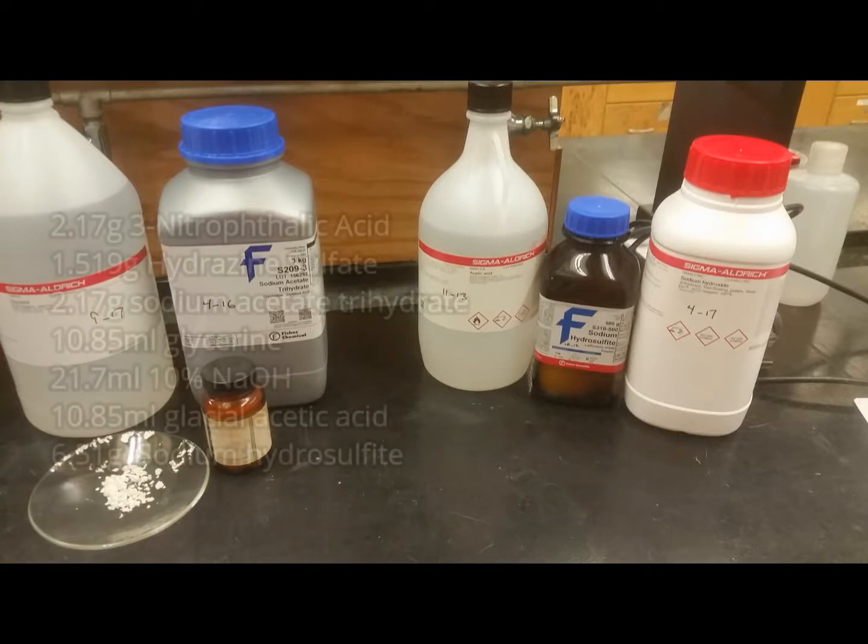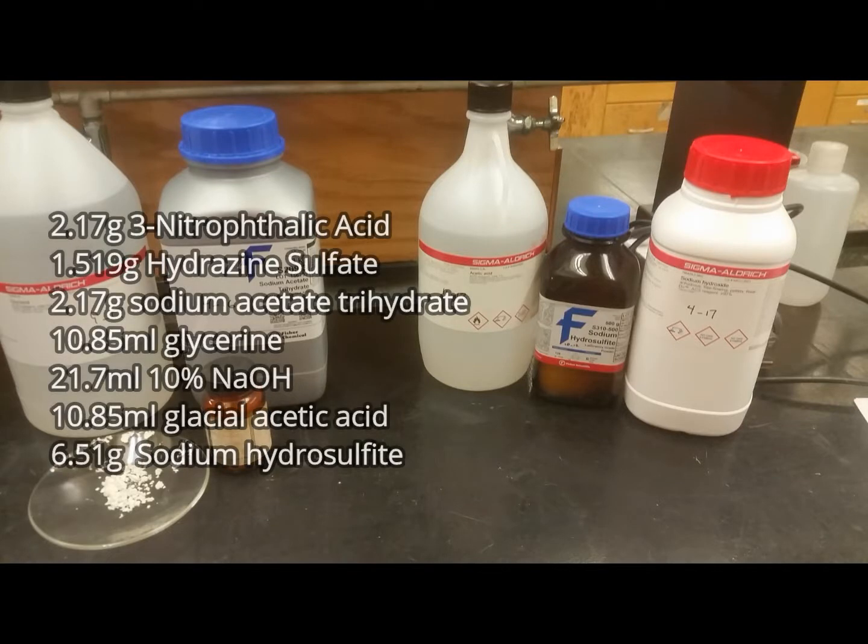These are the chemicals we will need for this experiment. The 3-nitrophthalic acid was something I synthesized in an experiment earlier.